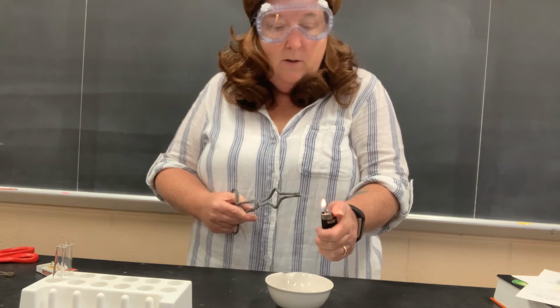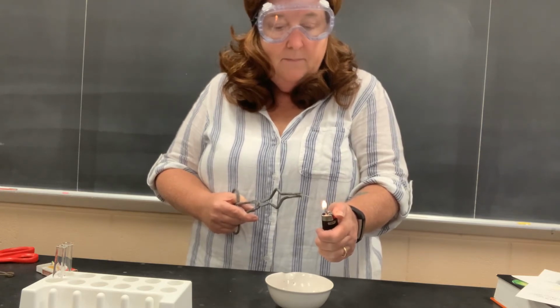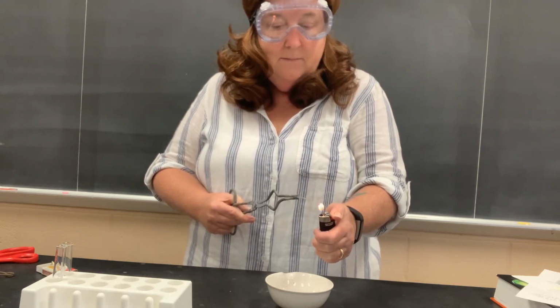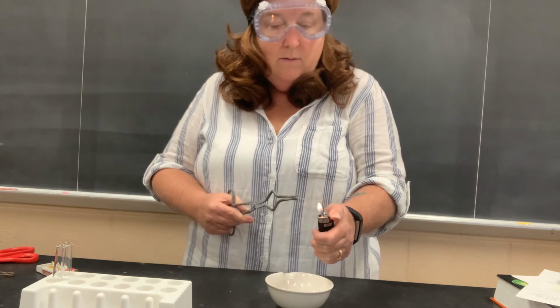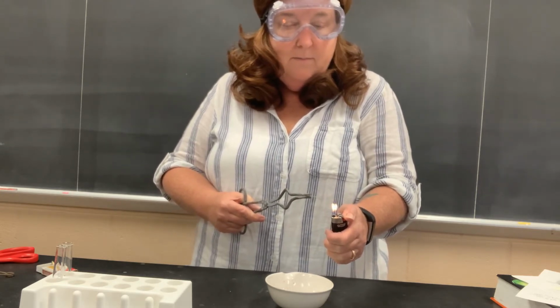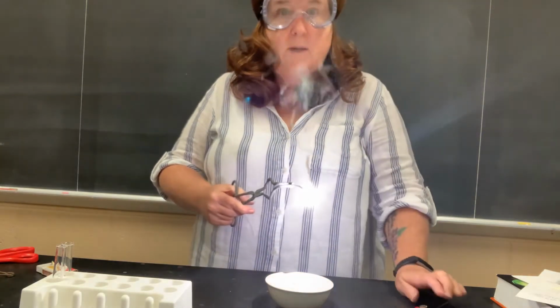Put it in the hottest part of my flame. And I wait patiently. Oh, come on. It's getting there. And there we go.